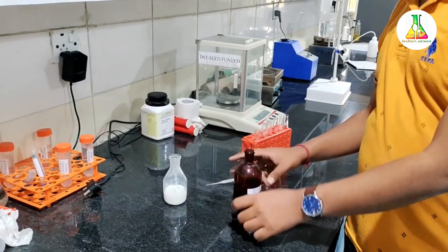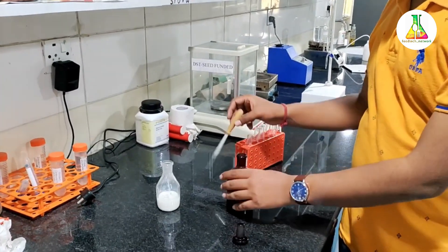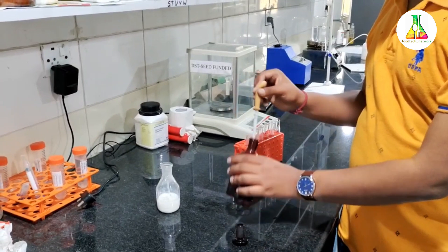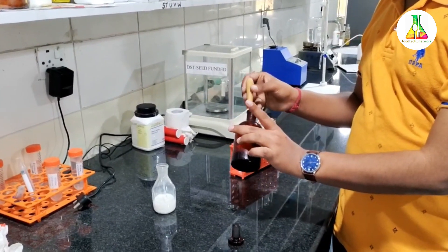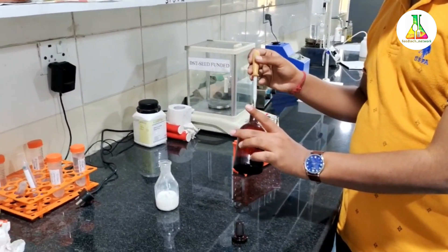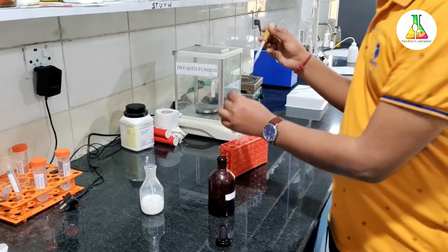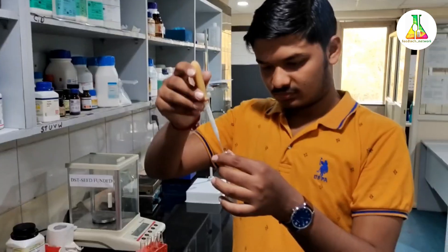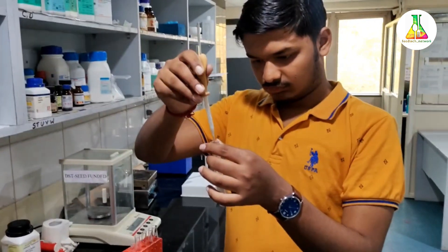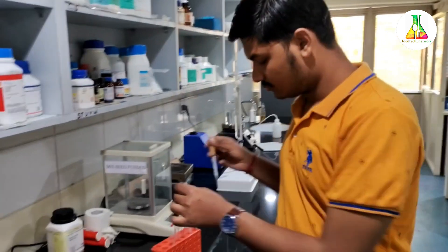Open it carefully and add a few drops of iodine.